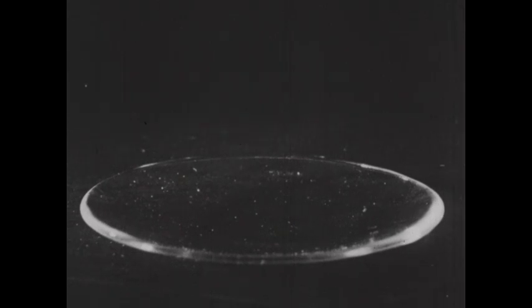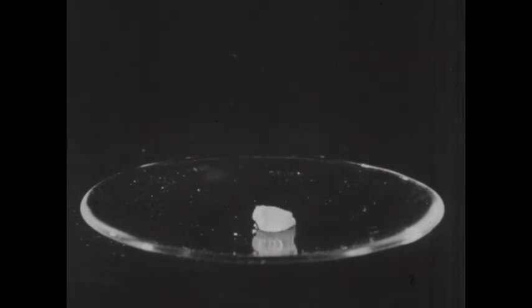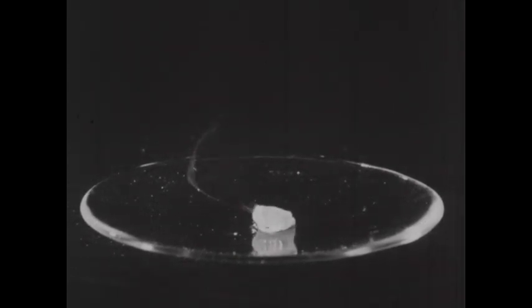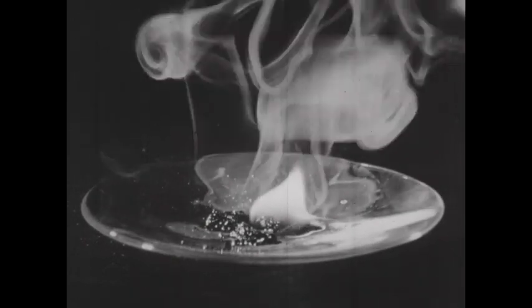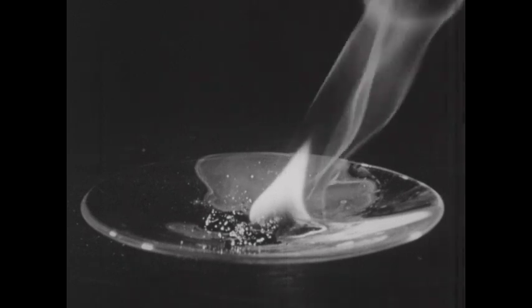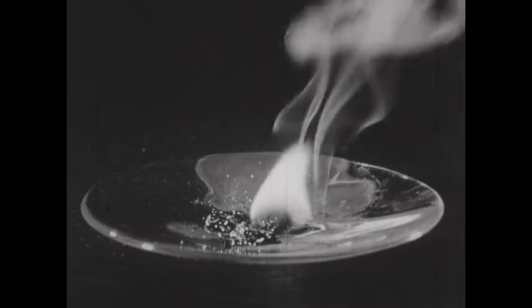White phosphorus reacts rather rapidly with most of the halogens. We can illustrate this by putting a small piece of white phosphorus on the watch glass and adding some crystals of iodine. The heat of the reaction causes the phosphorus to burst into flame. The product of the reaction is phosphorus triiodide, and the balance of the phosphorus then simply burns, forming phosphorus pentoxide.